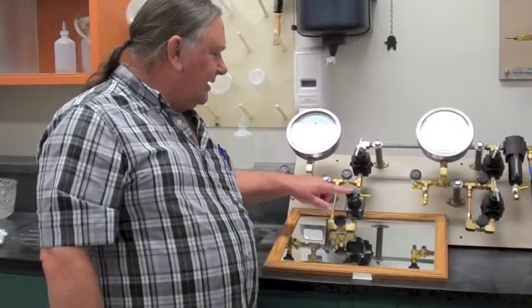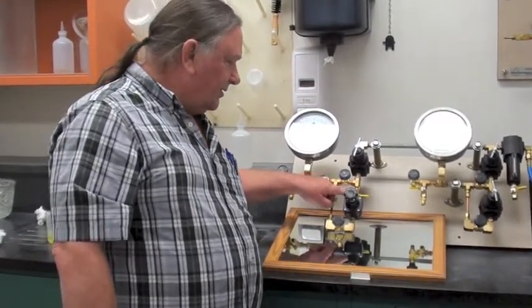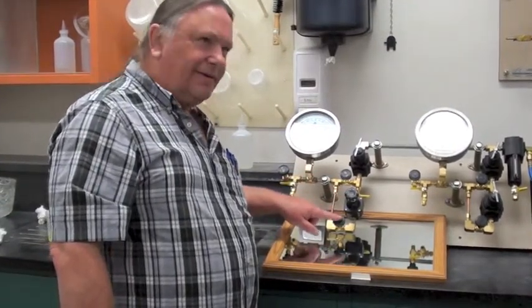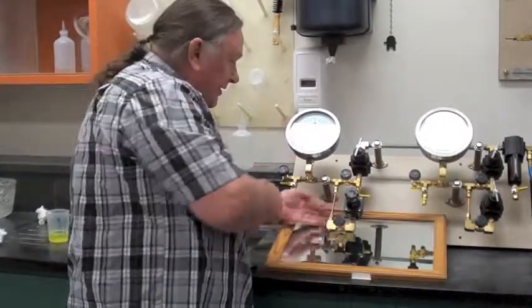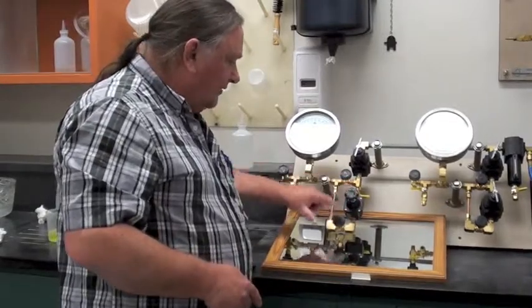Okay, once again, if you want to isolate out the Nullmatic, you must turn off this and you must turn off this. If you forget to turn off this, you'll have lots of air coming out. If I open this, the pressure drops here, lots of air, lots of air. So to isolate out: off, off.